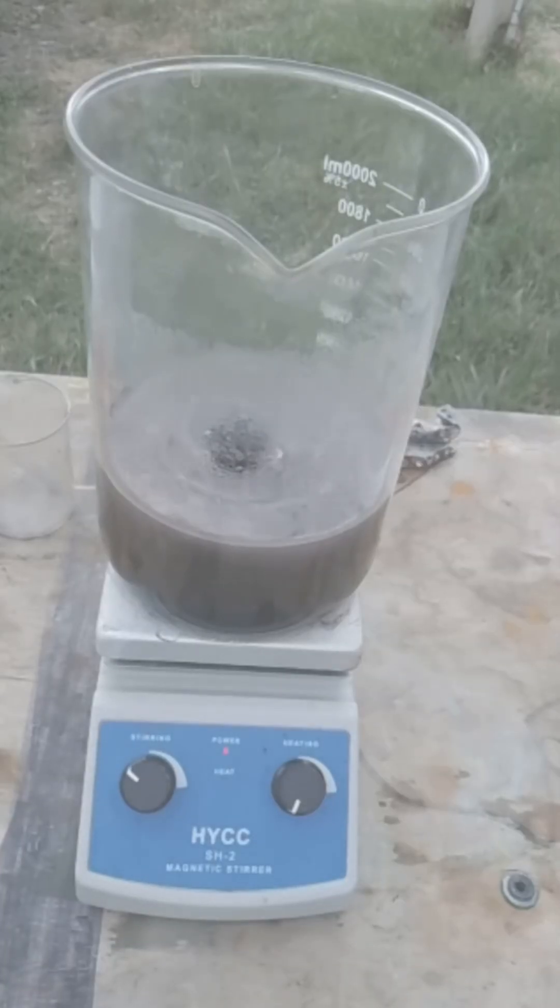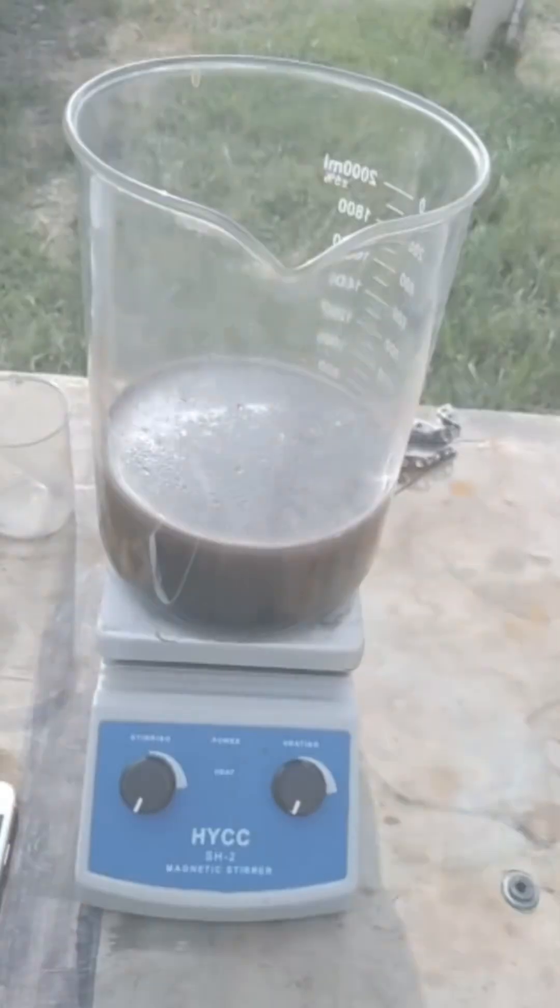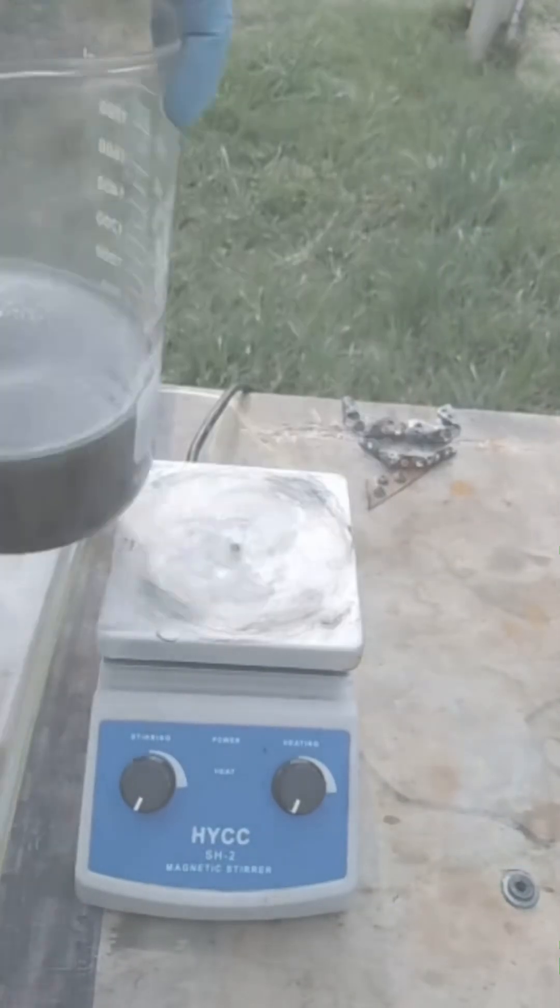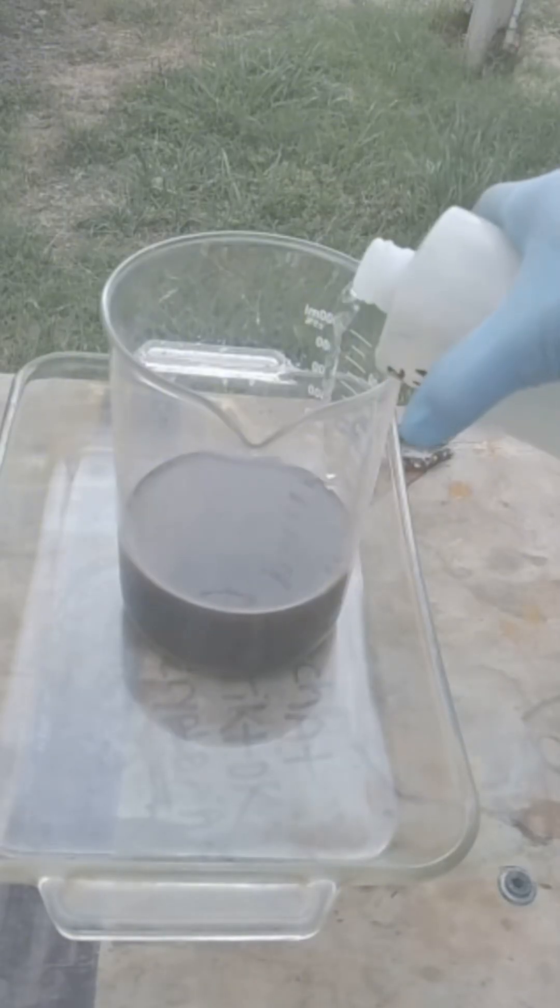Here I have some used sugar. So a lot of people you're going to see just put straight sugar into it. What I did is I prepped 100 milliliters. For every 100 milliliters, I put two tablespoons of sugar. But I warmed up the 100 milliliters of water first and then I added the sugar into it to dilute it into a liquid form. So now here you see me mixing it in and it worked perfect, instantly worked. It worked real great.